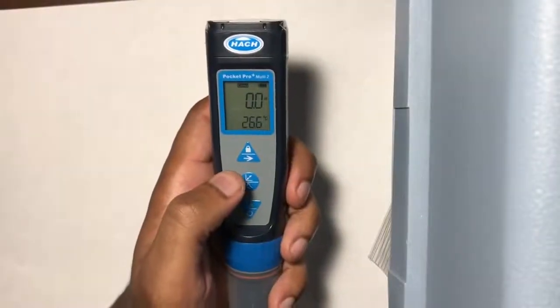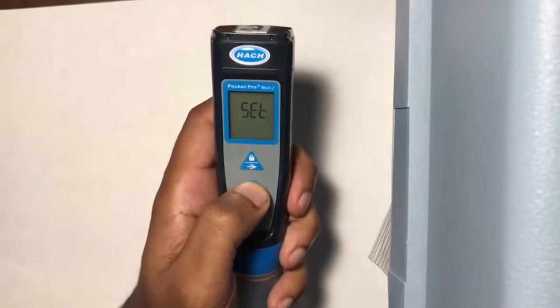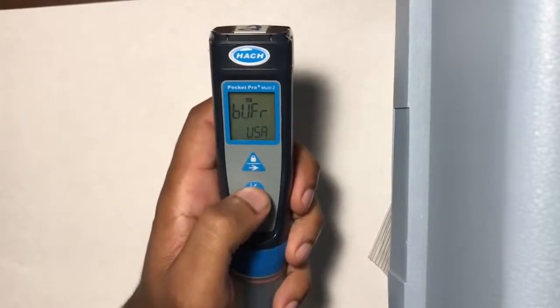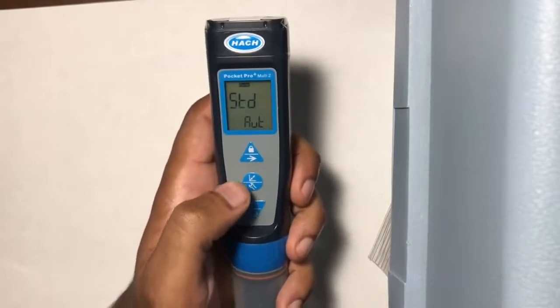To review and check the settings, press and hold the middle button to enter settings mode. You know you're in settings because SET appears on the screen. Tap the middle button to scroll through the different parameters, and you use the top and bottom buttons to change each parameter's settings.